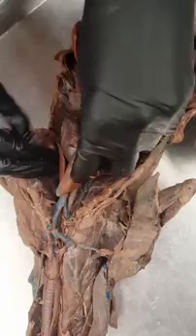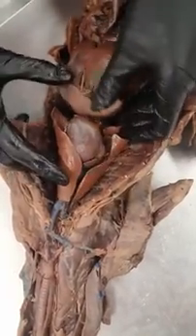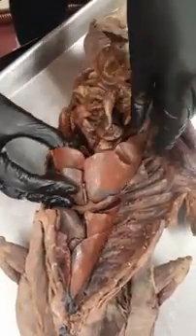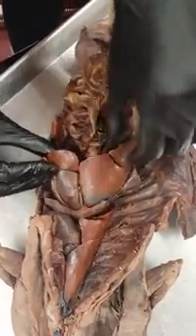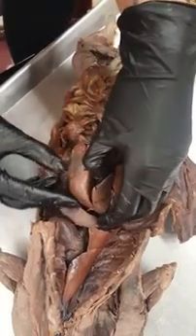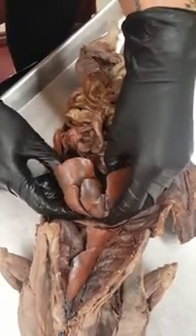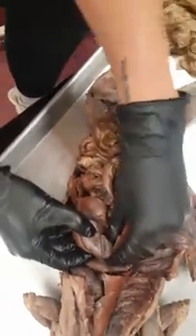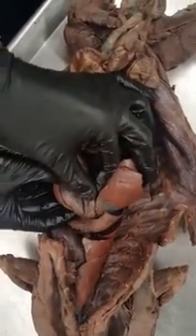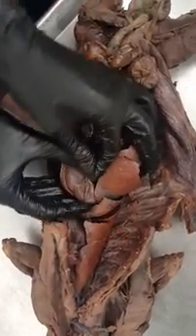Here we've got our lungs, our heart, our diaphragm. We've got our right median lobe of our liver, our right lateral lobe of our liver, our quadrate lobe, our left median lobe, and our left lateral lobe. This little flappy thing is our gallbladder, and your gallbladder is responsible for storing bile.